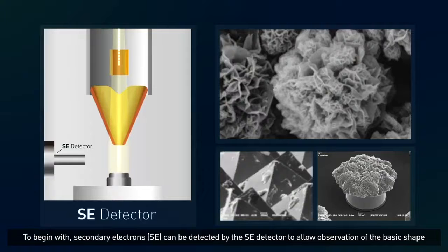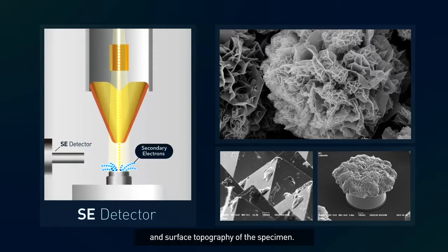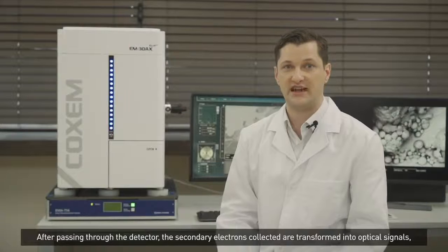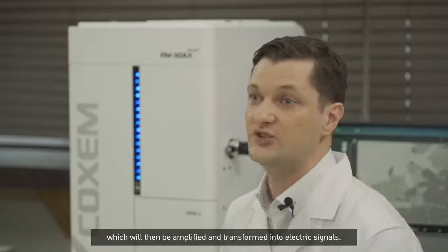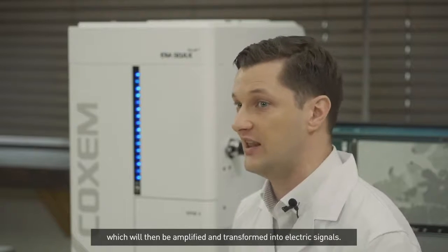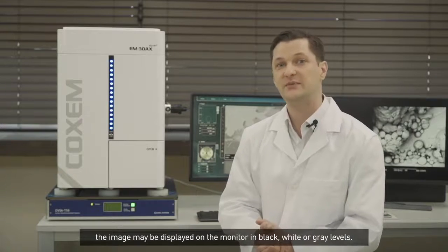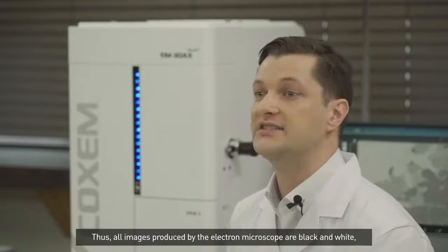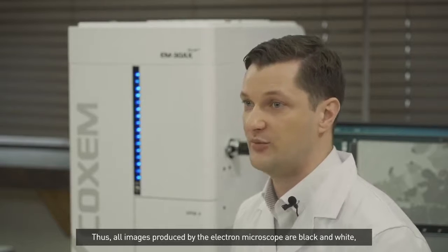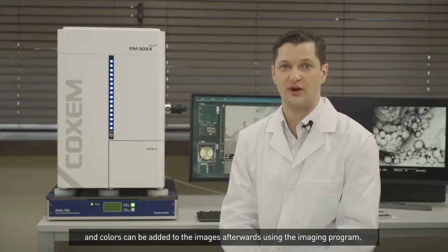To begin with, secondary electrons can be detected by the SE detector to allow observation of the basic shape and surface topography of the specimen. After passing through the detector, the secondary electrons collected are transformed into optical signals, which will then be amplified and transformed into electric signals. Depending on the quantity and brightness of these signals, the image may be displayed on the monitor in black, white, or gray levels. Thus, all images produced by the electron microscope are black and white, and colors can be added to the images afterwards using the imaging program.